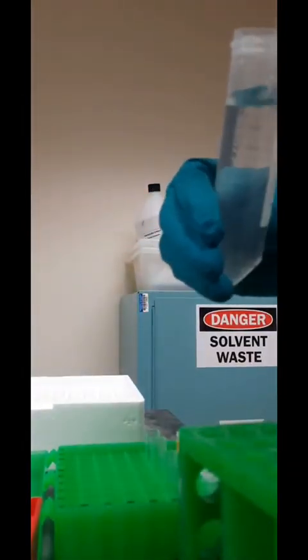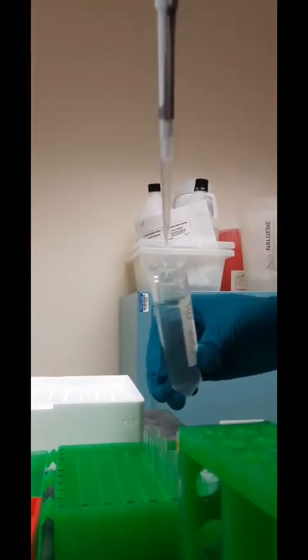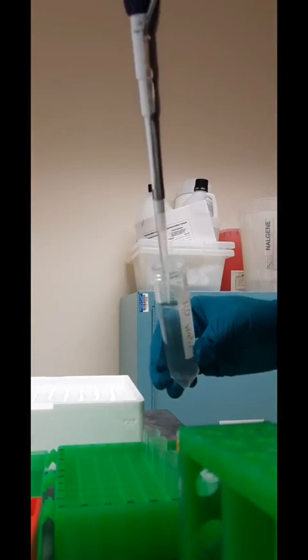Now I'm just adding water to bring up the volume because they need to be pretty dilute for DLS and zeta potential measurements. If they're too concentrated, the instrument will think the nanoparticles are larger than they actually are.